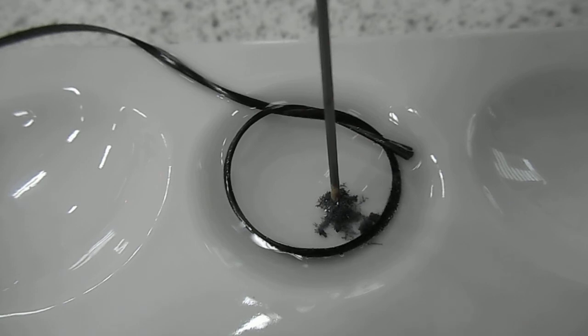A dark grey solid was produced around the cathode, that's lead metal. It's migrated towards and is now touching the anode.